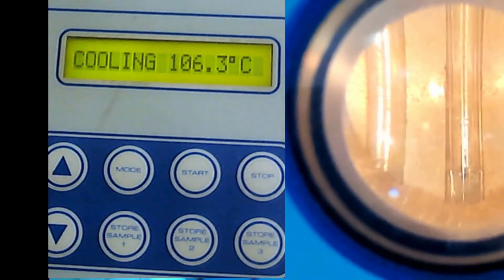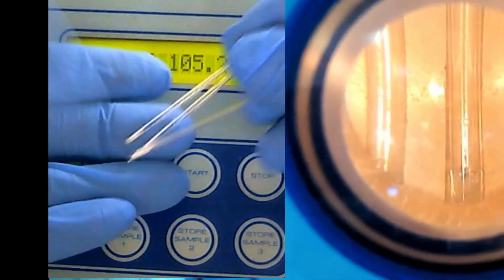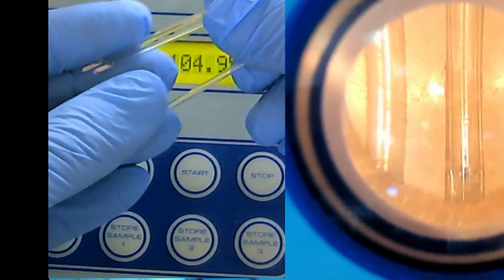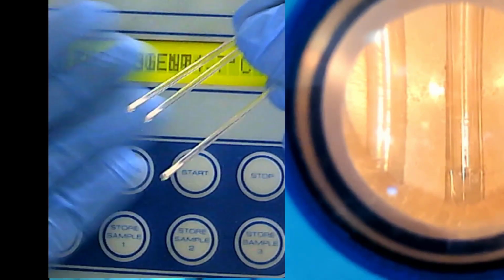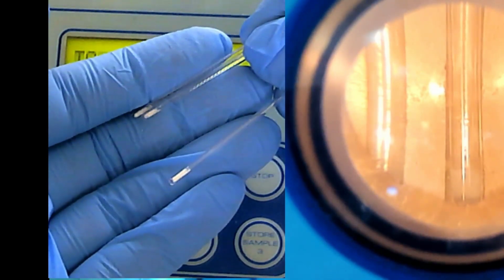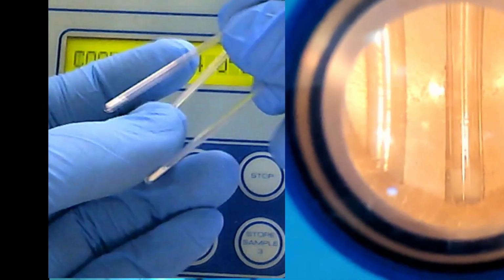So I will mix these two mixtures. For that I already have these three. If you look here, I have already three. These I already mixed. After this I will show how to mix it. But basically these three I already mixed, our unknown with each of the Group 1 substances. So this is the mixture of all of them. I don't know which one is which.